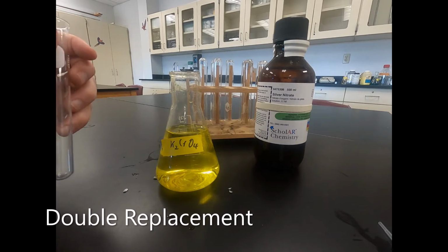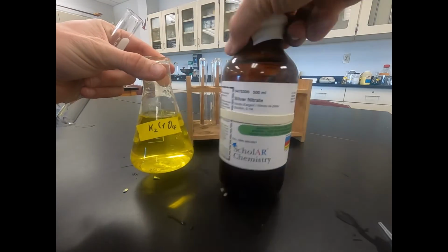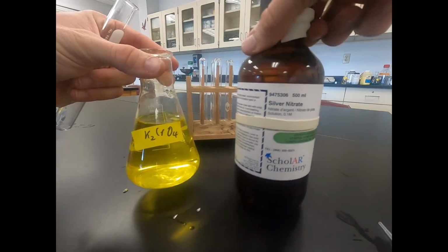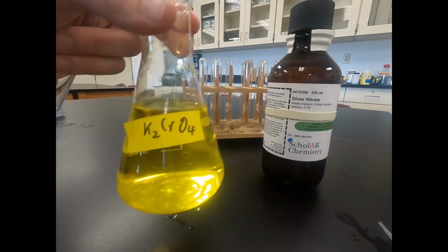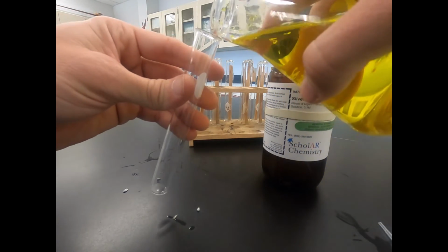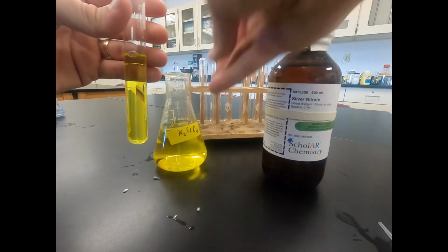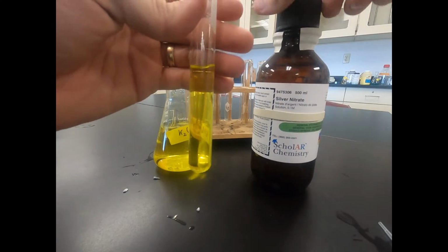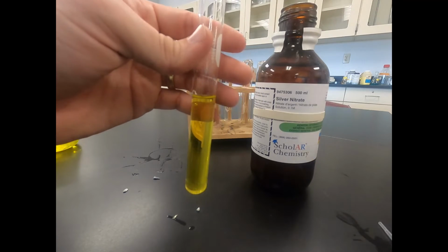For our next reaction, we're going to react potassium chromate with silver nitrate. Silver nitrate's a clear liquid. You can see the potassium chromate is a yellow liquid. I'll start by just pouring some of that potassium chromate into a test tube. And then into that same test tube, I'm just going to add in, and I'll move that out of the way, I'll add in some silver nitrate.